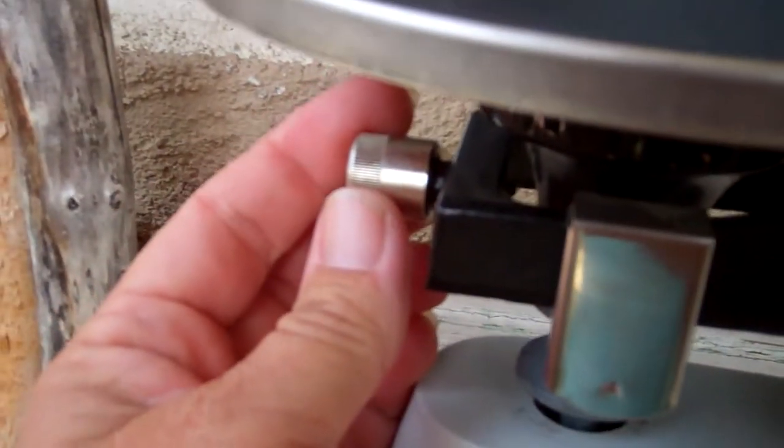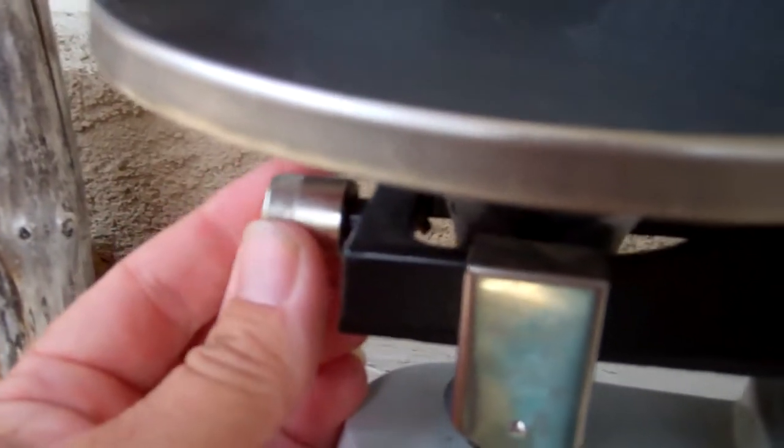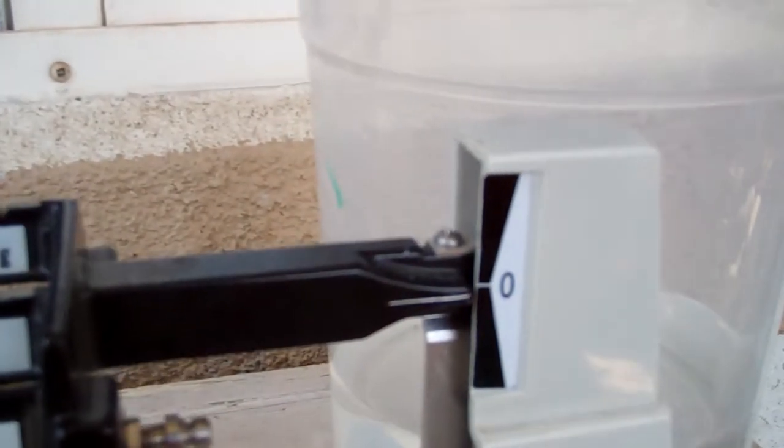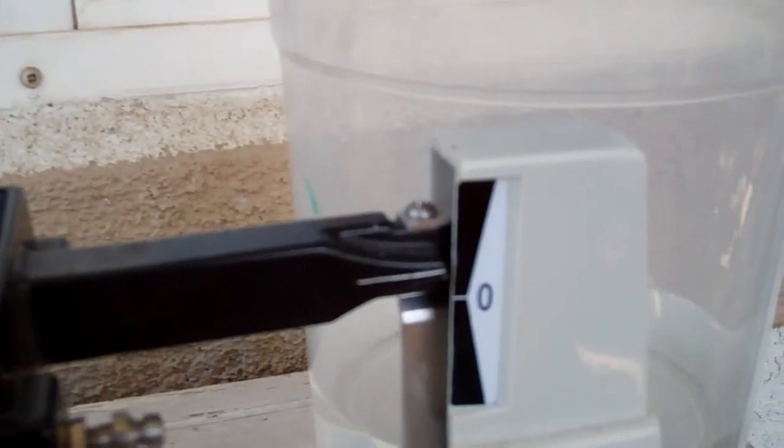If you need to make the line go up, then you would turn the knob away from you. You turn it up. Whatever you need to do, you do up or down. Whatever you need to do in order to make those two lines meet. Then you're zero line to zero. And you're ready to go.